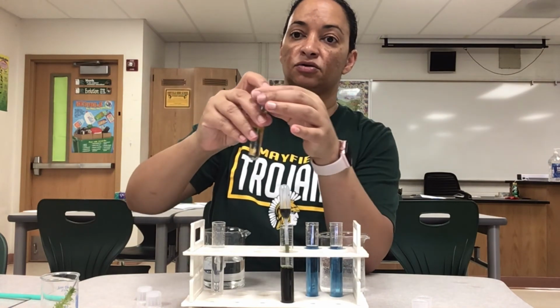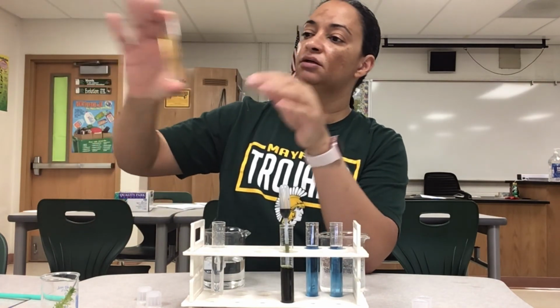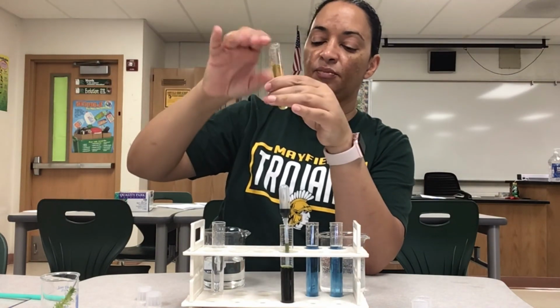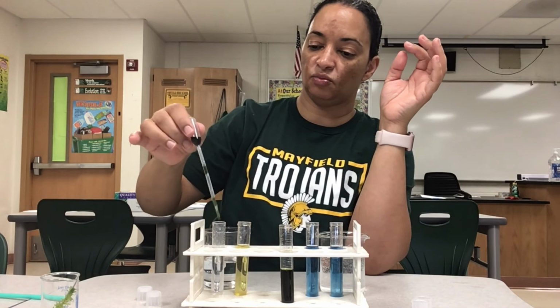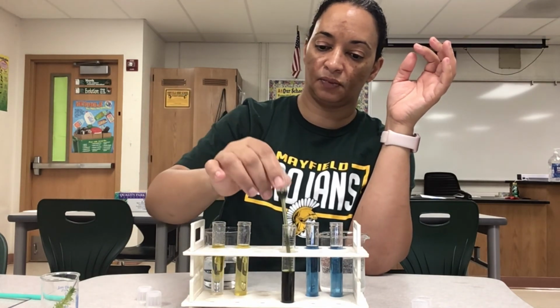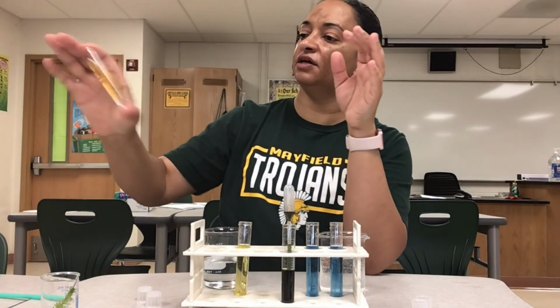Okay. So it started off a little bit green, shake it up, I got myself a nice yellow solution. Let me mix that up really good. Okay, so I'm going to add some more to this one. There we go. Give it a nice shake.